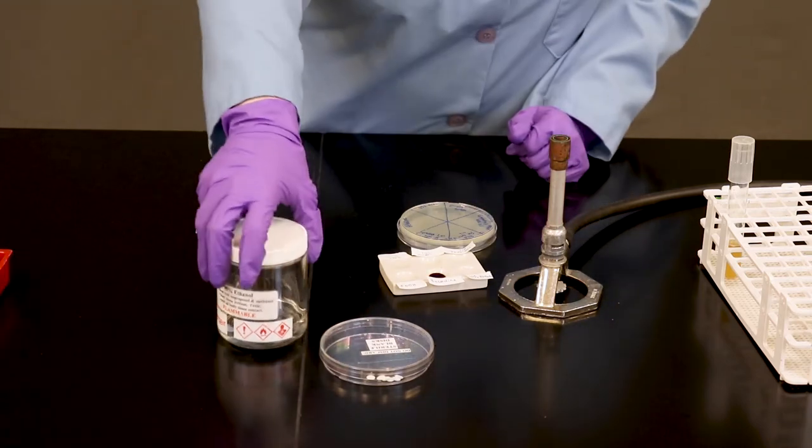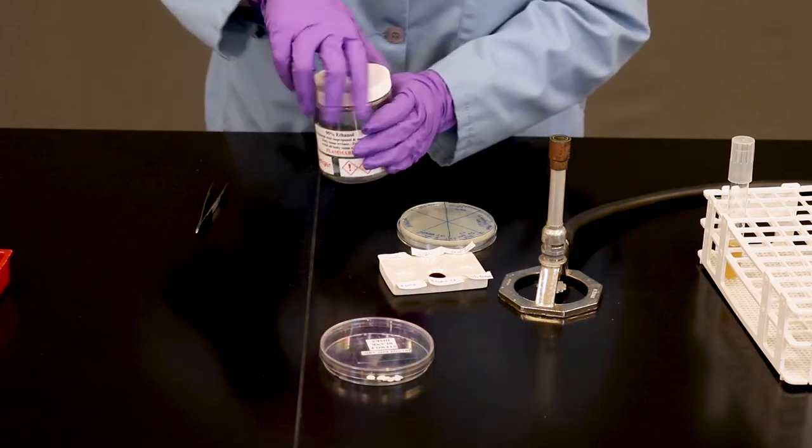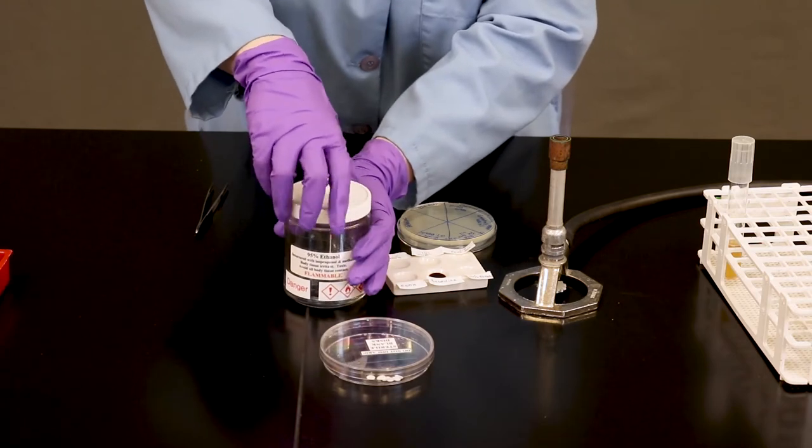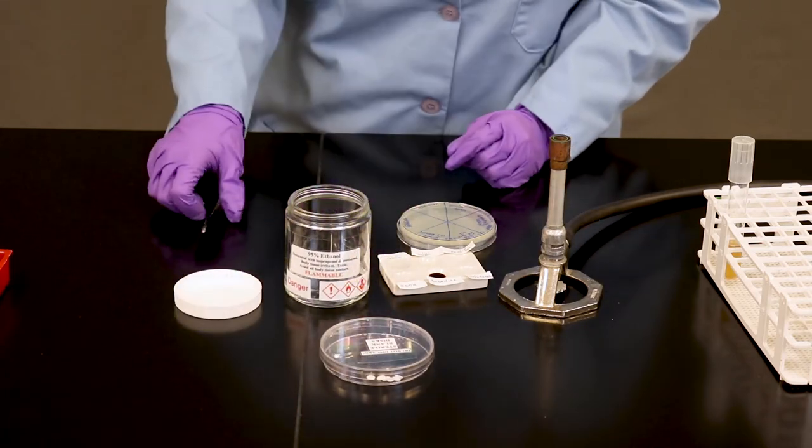The next thing you want to do is have the beaker or the bottle of ethanol for sterilizing our forceps ready. Remember, this is very flammable, so be careful while you're working with it.